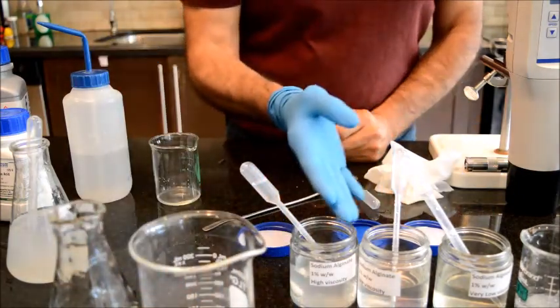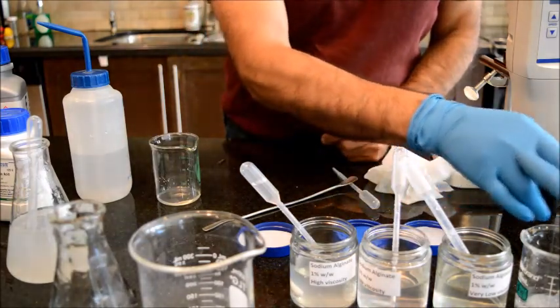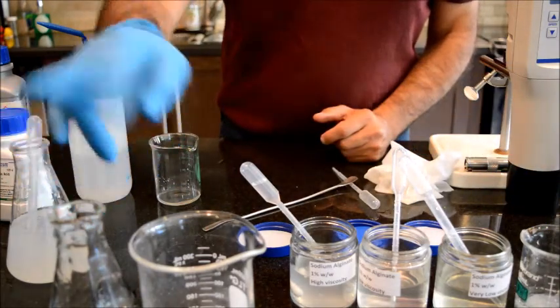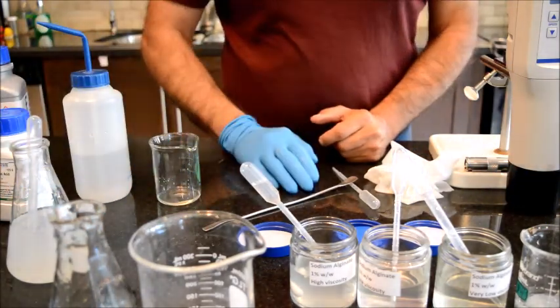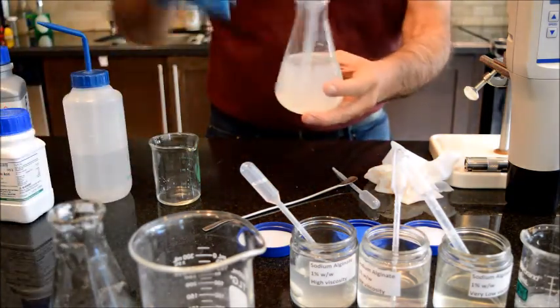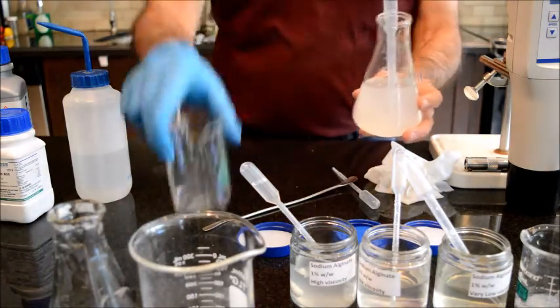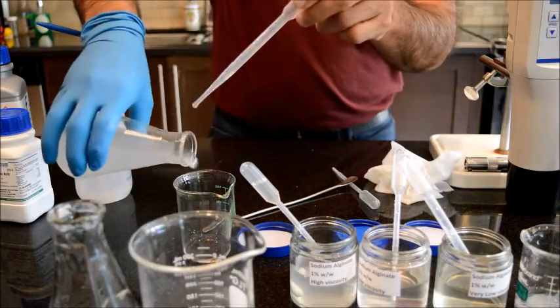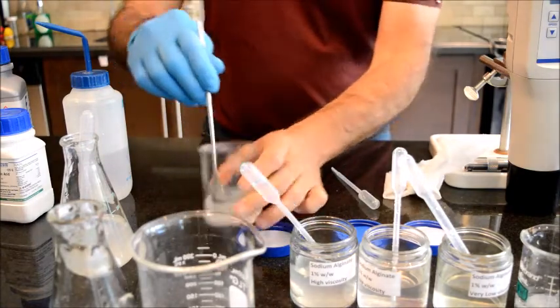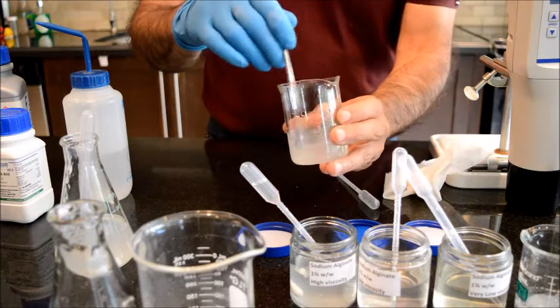So in the case of alginic acid, by adding calcium chloride we end up increasing the viscosity significantly higher, and in the case of carbomer it is the opposite. We actually destroy the gel. And in the case of xanthan gum, I don't have any more beakers, but I will add a little bit of this calcium chloride here. In the case of xanthan gum, it does increase viscosity somehow, but not as much.